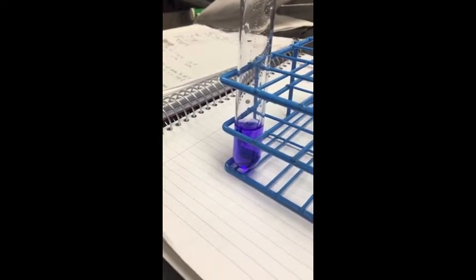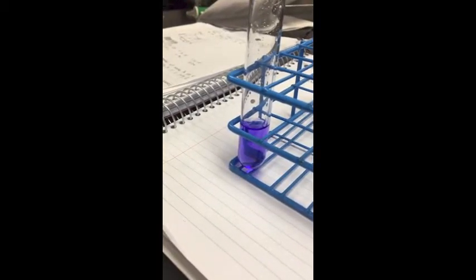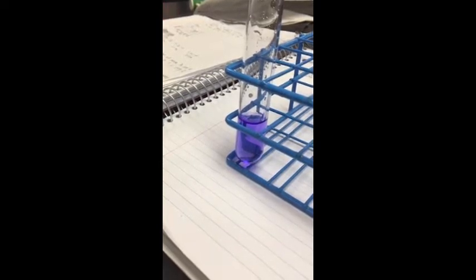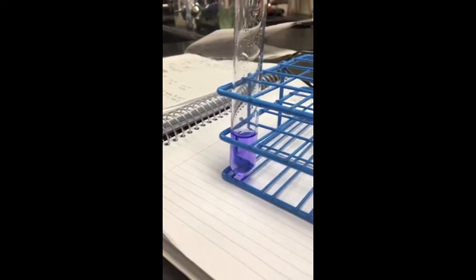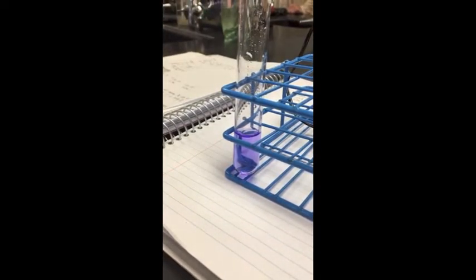Next, we did the reaction between the 20 micromolar crystal violet and sodium hydroxide. We diluted the crystal violet to the molarity we wanted by using 8 milliliters of CV and 2 milliliters of NaOH. We used the colorimeter to track the absorbance over time as the reaction took place. Here is a sped up clip of the reaction happening outside of the colorimeter.